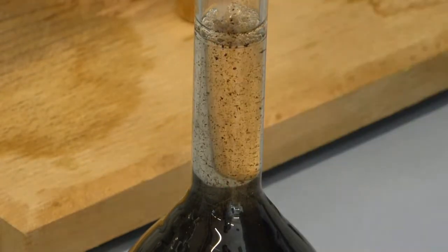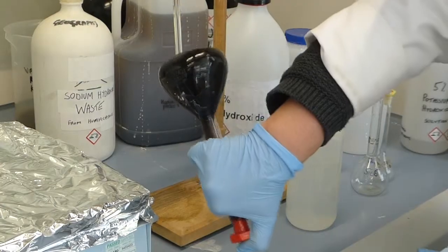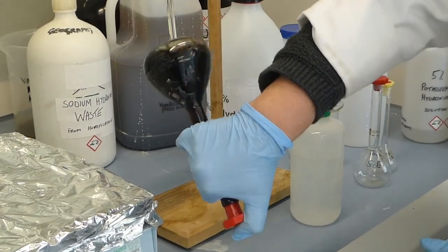Then stopper the volumetric flask and invert several times because you want the solution to be well mixed.